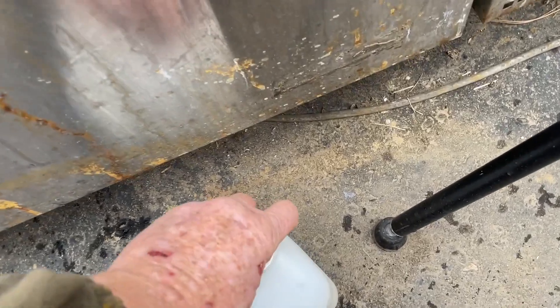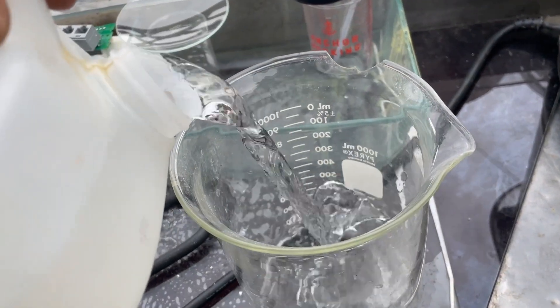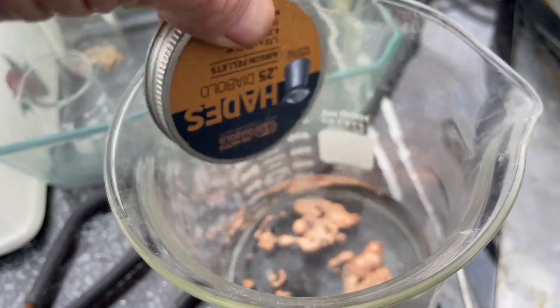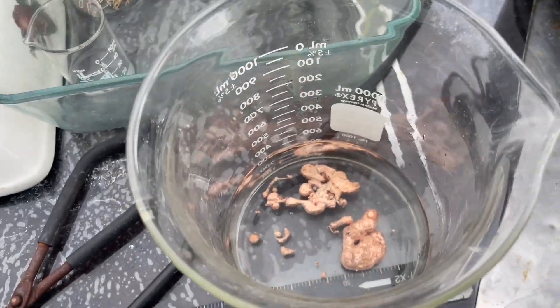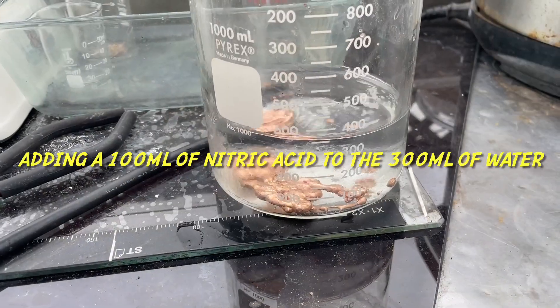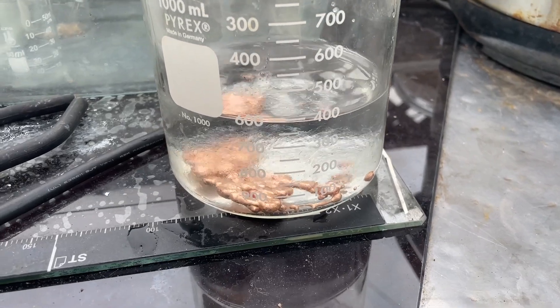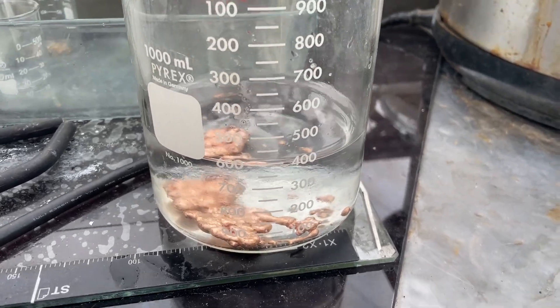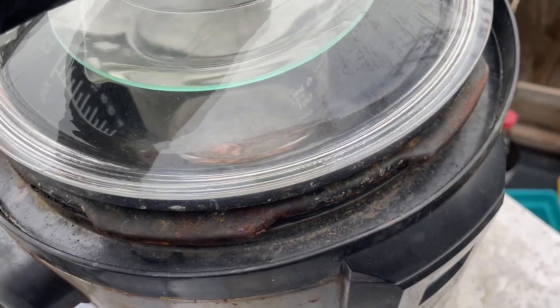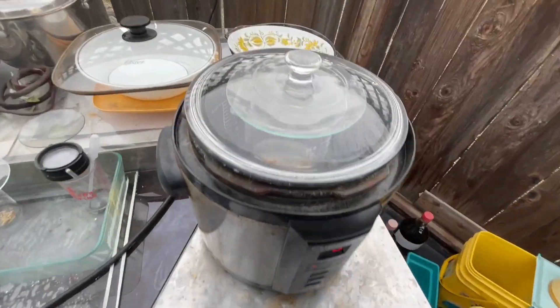We've got a beaker here. I'm going to add a little bit of water to it — about 300 to 400 milliliters. This is the gold-filled scrap that we basically melted the heck out of. One third, not one half. There we go, that'll heat up quick.